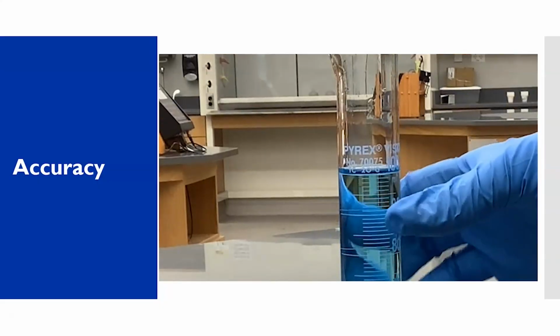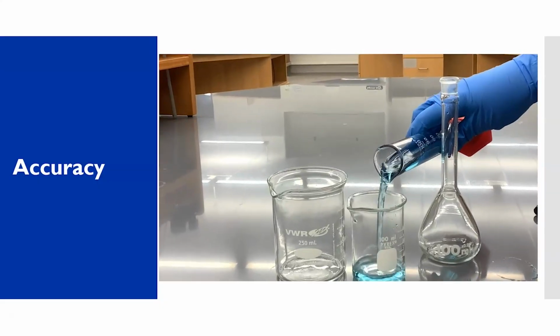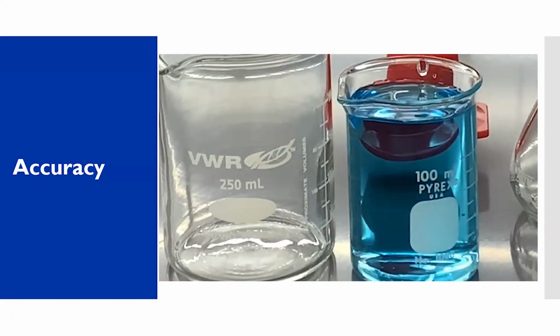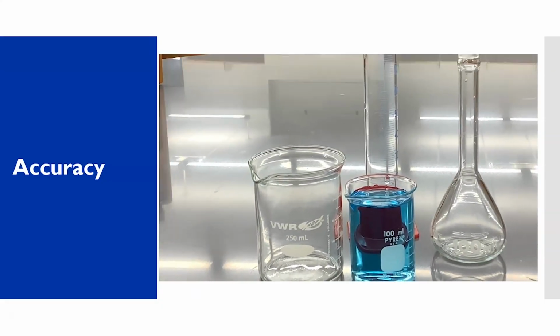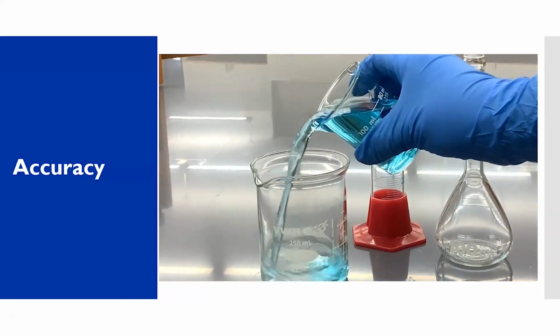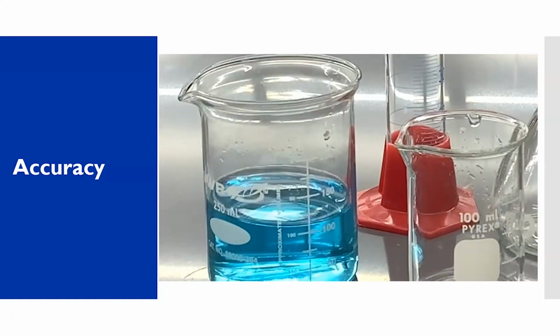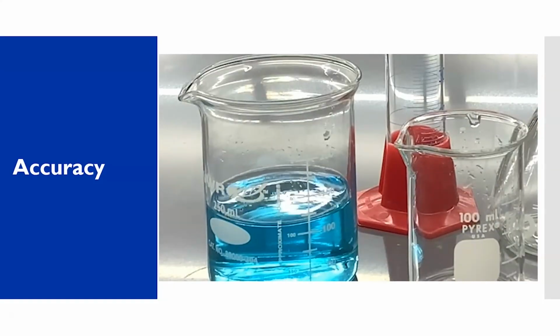This is not true as I pour this 100 milliliters into the 100 milliliter beaker. You'll see that it's almost full. And when that gets into the 250 milliliter beaker, these are much less accurate measuring devices and should not be used to perform a measurement.